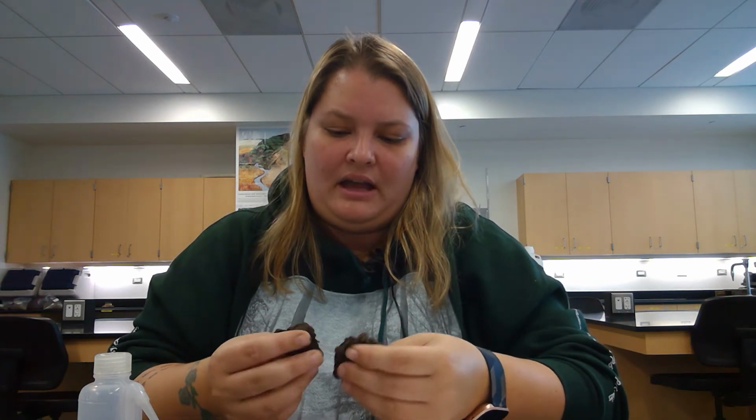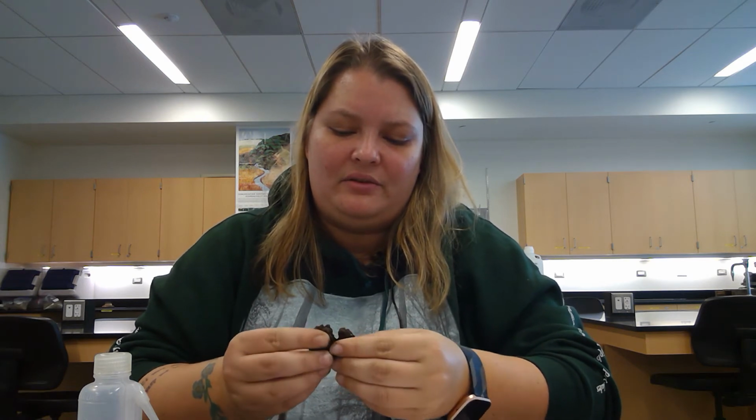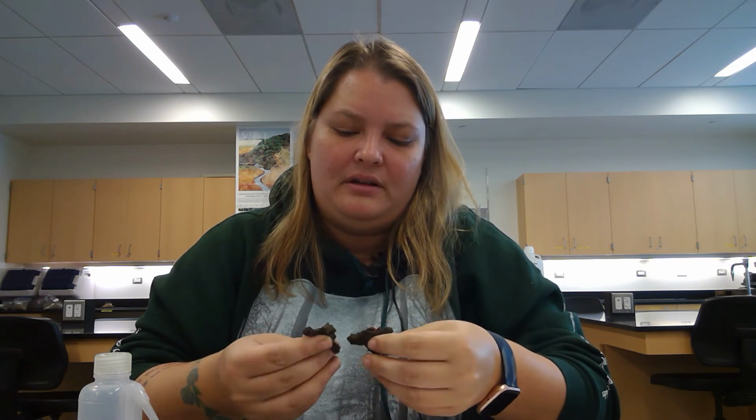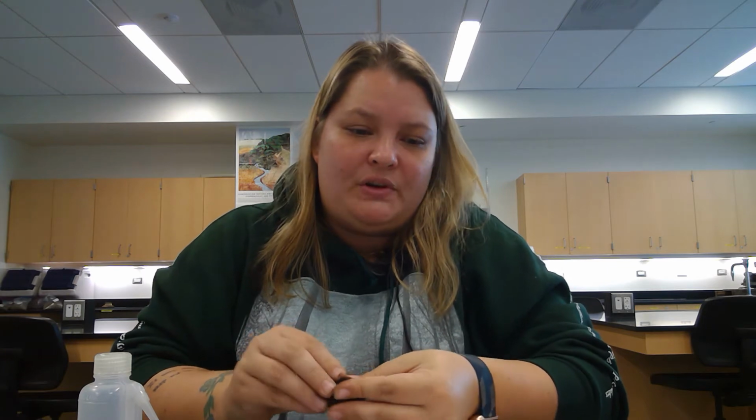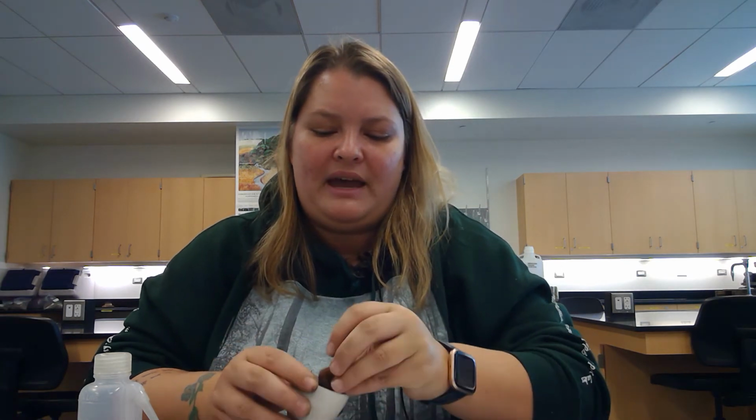All right, so you'll see with water that it does come back up again, but I don't have too much moisture, so that if you squeezed it, no drops of water come out. So I would say that this is pretty good tilth. Now we're going to fill the crucible full of this good tilth soil and compact it again, as we did back in step 2.